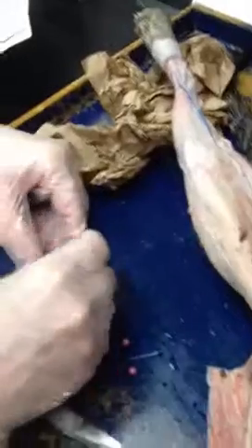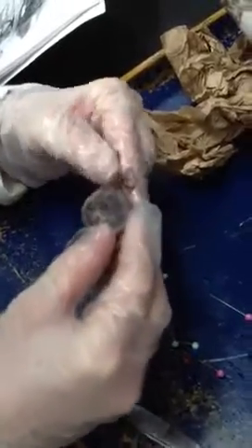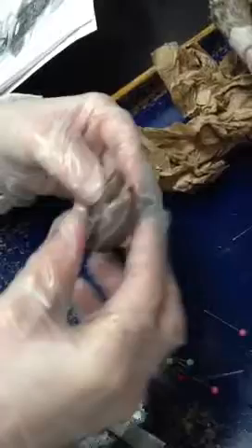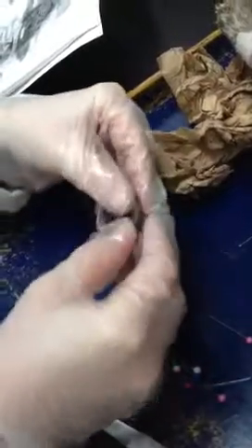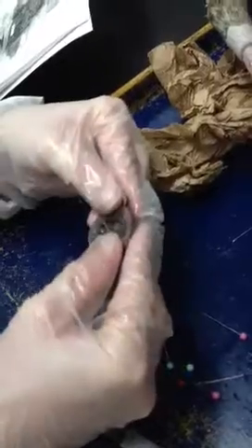Yeah, you can take them out. We just needed to clarify for ourselves. Oh, that's why we couldn't tell. Okay, let's do this side. I don't like that side. A couple shots at this, and that's it. Yours may not be the best. Okay, that's okay. Oh yeah, that's what I was looking for. The spider web.